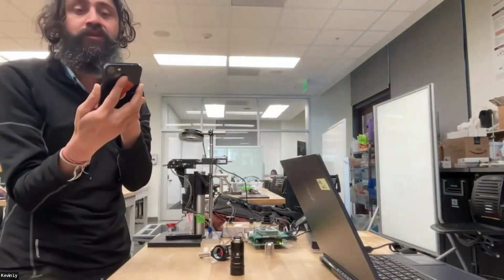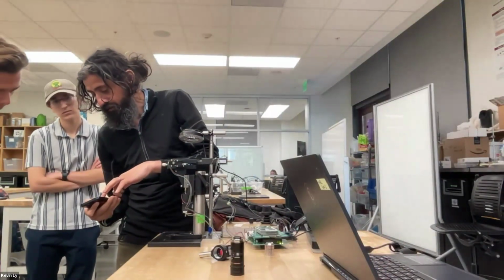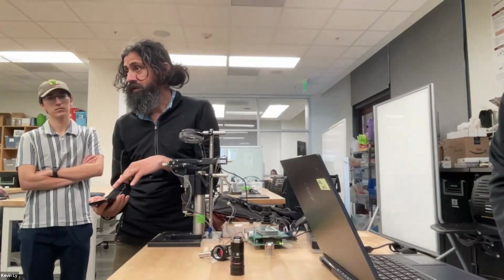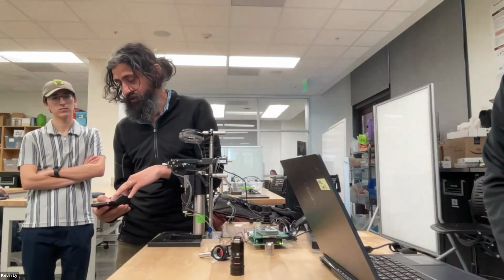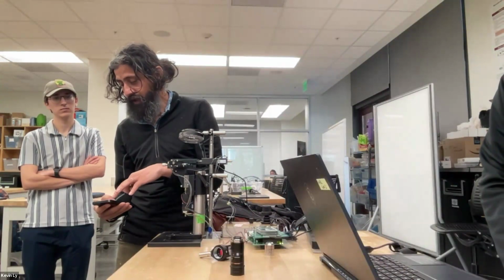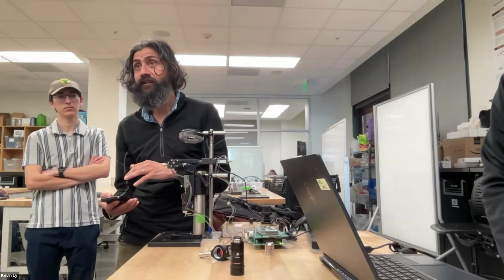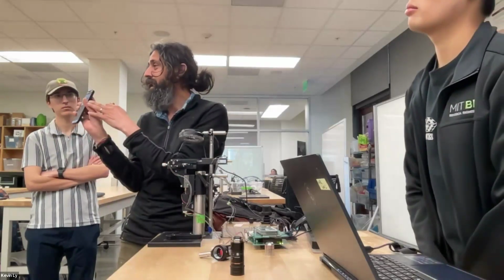1, 2, 3, and some of them you see stack back to back. You notice that this lens sits perfectly with this lens, and there is optical glue that binds many of them together. So these are many, many surfaces. So let's count: 1, 2, actually 10 might be right. 1, 2, 3, 4, 5, 6, 7, 8, 9, 10, 11, 12, 13, 14. So this single objective, and you can tell the way that it's aligned.